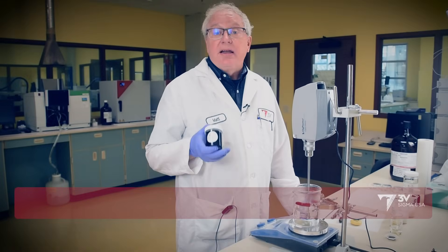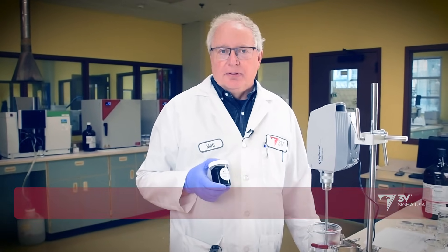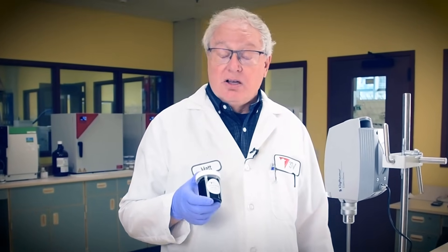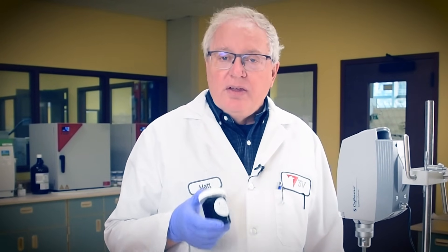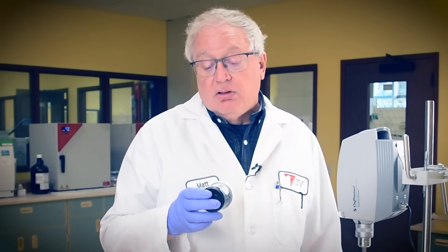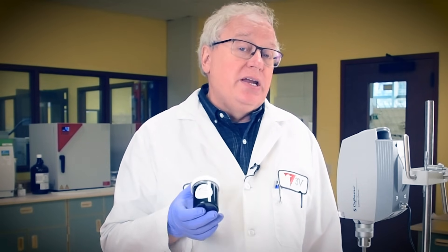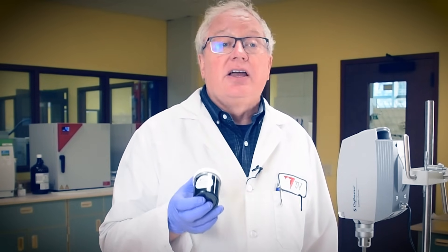Today in our applicative laboratory we'll be compounding a dense brown ringing gel applied as a hair care fix-up product for edge and end styling. These water-soluble pomades are most popular in the multicultural market for customers of African, Latin American, and Mediterranean descent with wavy hair or curl types one to three. We'll color our gel dark brown for the value-added purpose of covering emerging gray on mahogany colored hair.